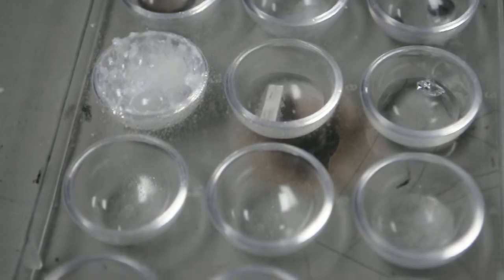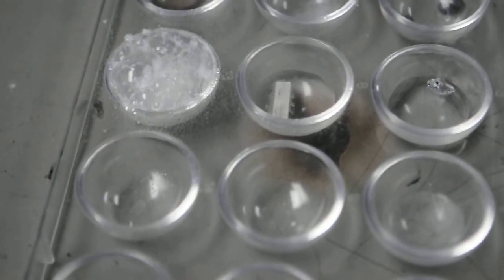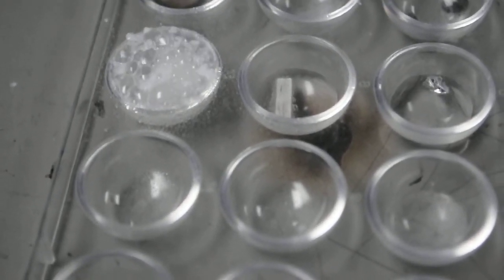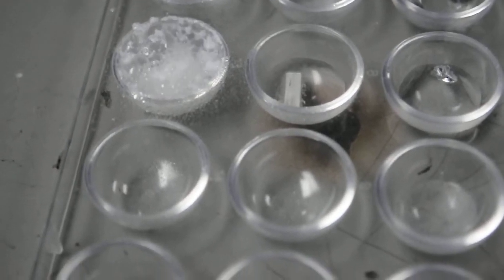Yeah, I can see that. It's bubbling. You see how the magnesium ribbon is moving? The bubbles there indicate you definitely have a reaction going on.